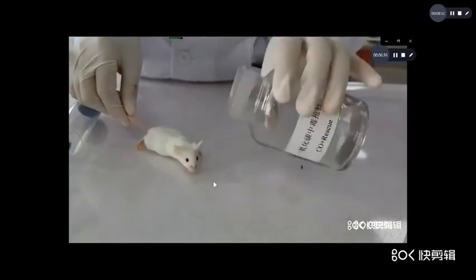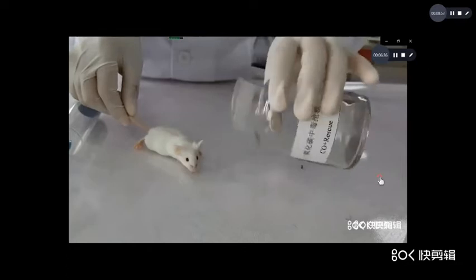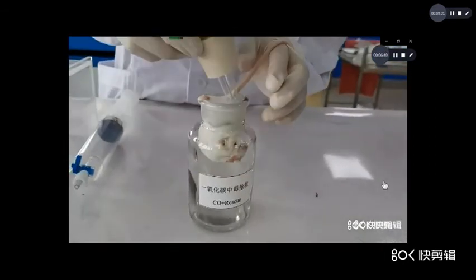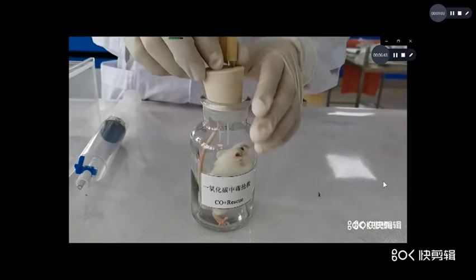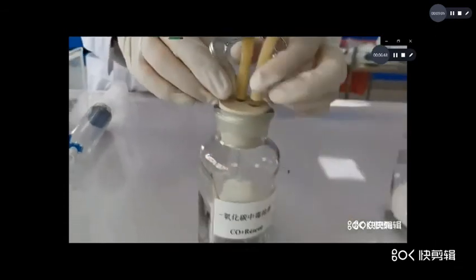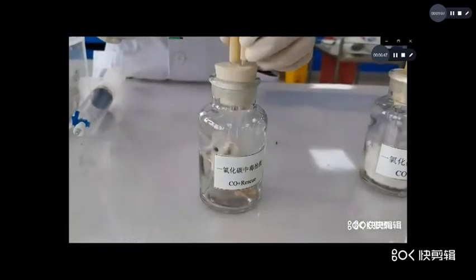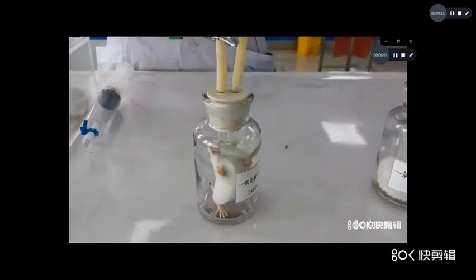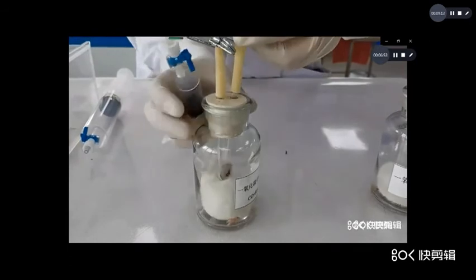Now take another mouse, also into the jar. Now you observe the normal respiration and the normal color of skin. Now open. Close.